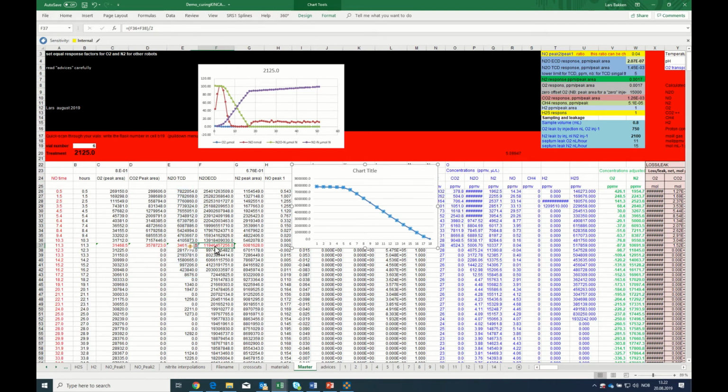And remember that when you do this, you still retain the original numbers in the raw data sheet, so you don't lose the information about the original value, but you fix it in order to calculate the reasonable rates and reasonable accumulated values. And that's absolutely necessary for a calculation. The alternative to doing this is to delete the entire row in your raw data set and then paste them in again, which takes some time, but it's doable. The calculations will still be correct, but you will ignore this data point.